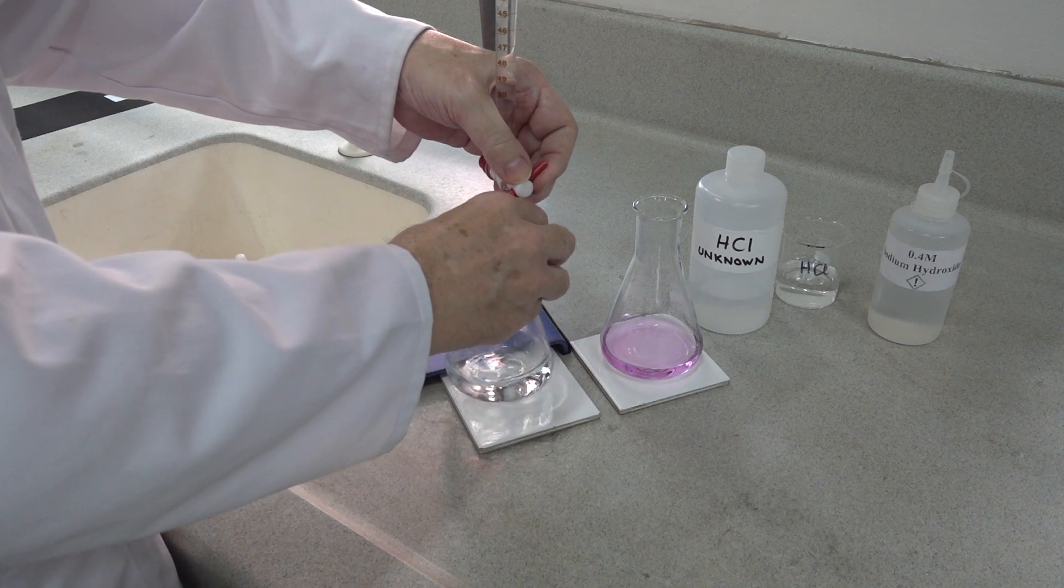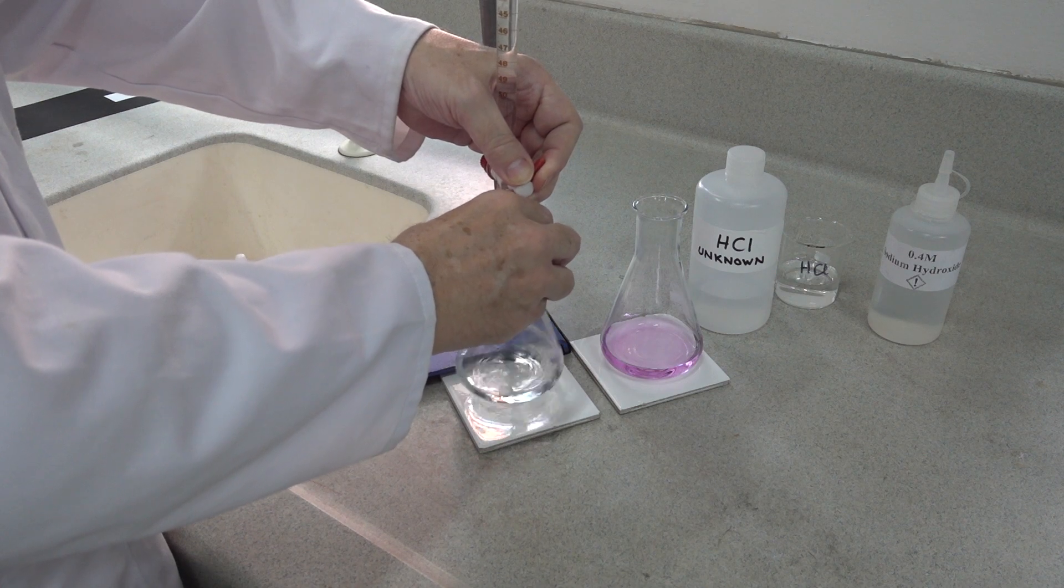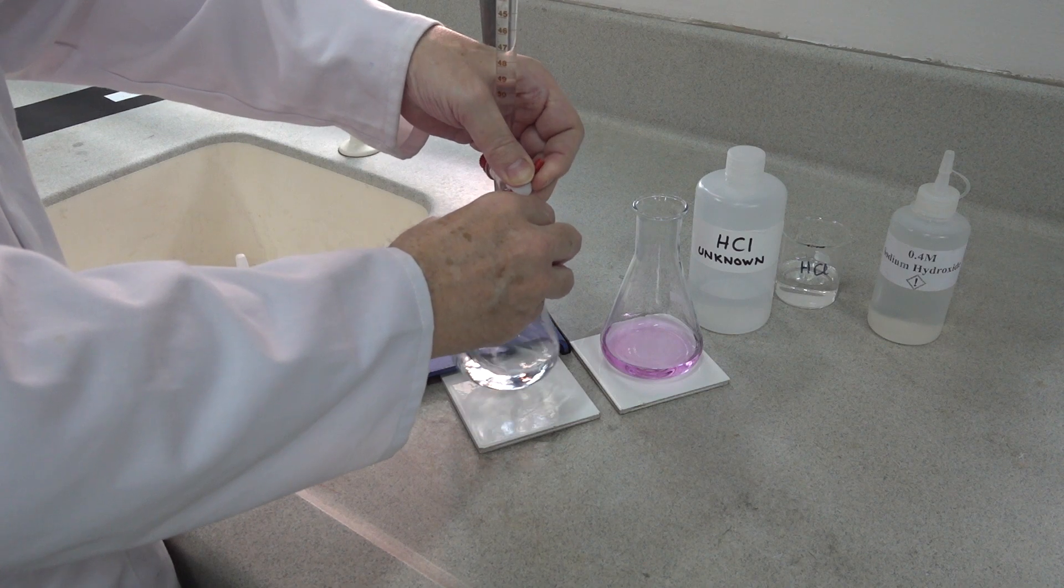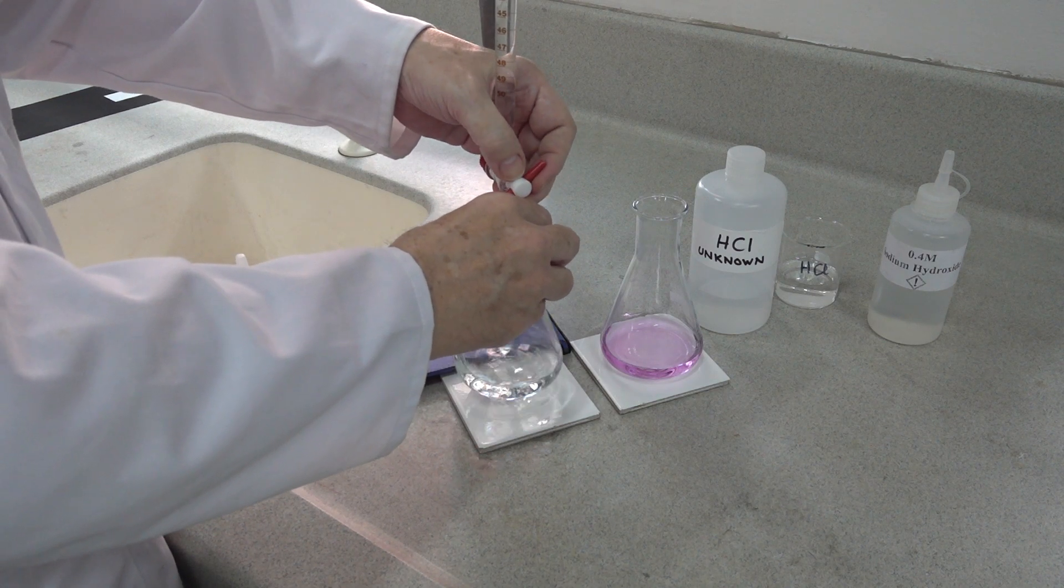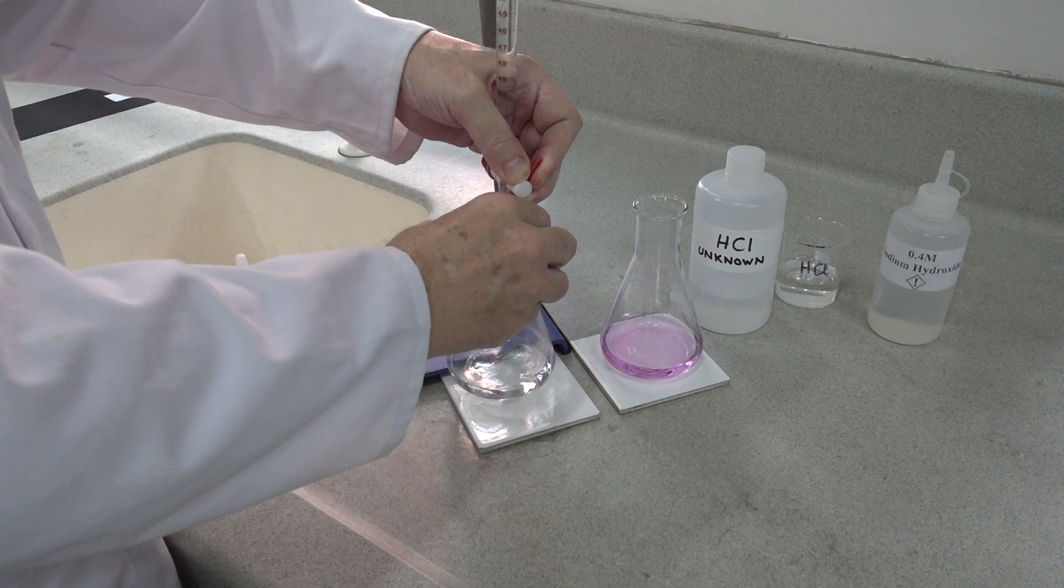We're very close. If you were very close in the laboratory, you would take a reading now, just in case you overshoot slightly. We're in a range of about a drop or two here.